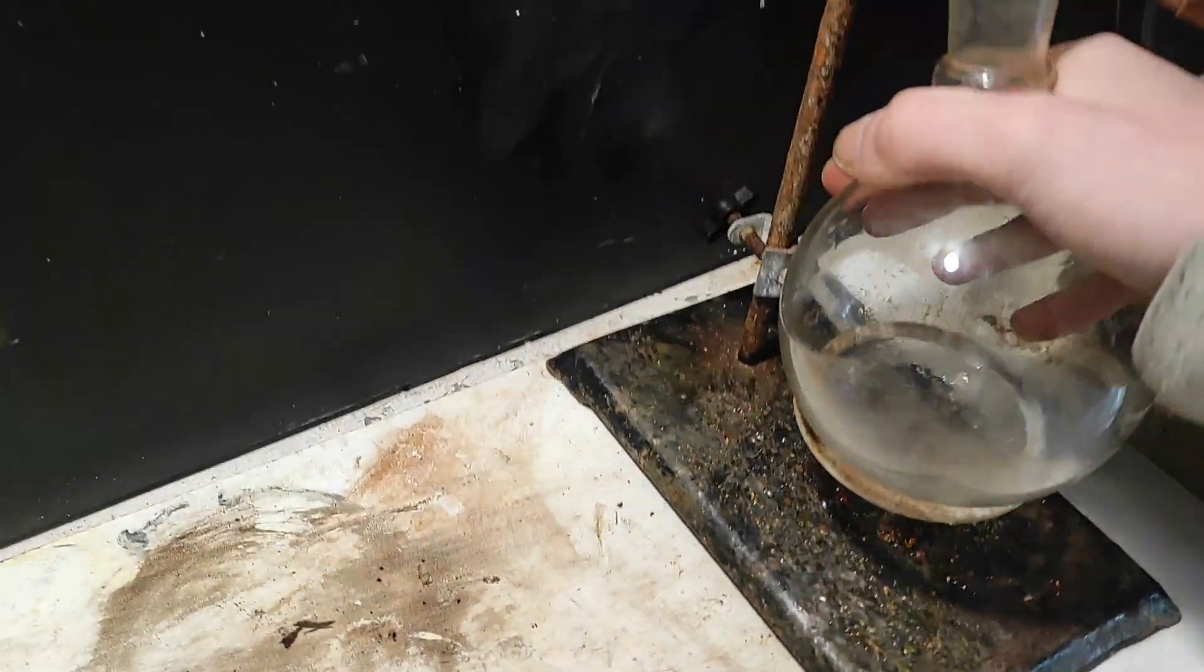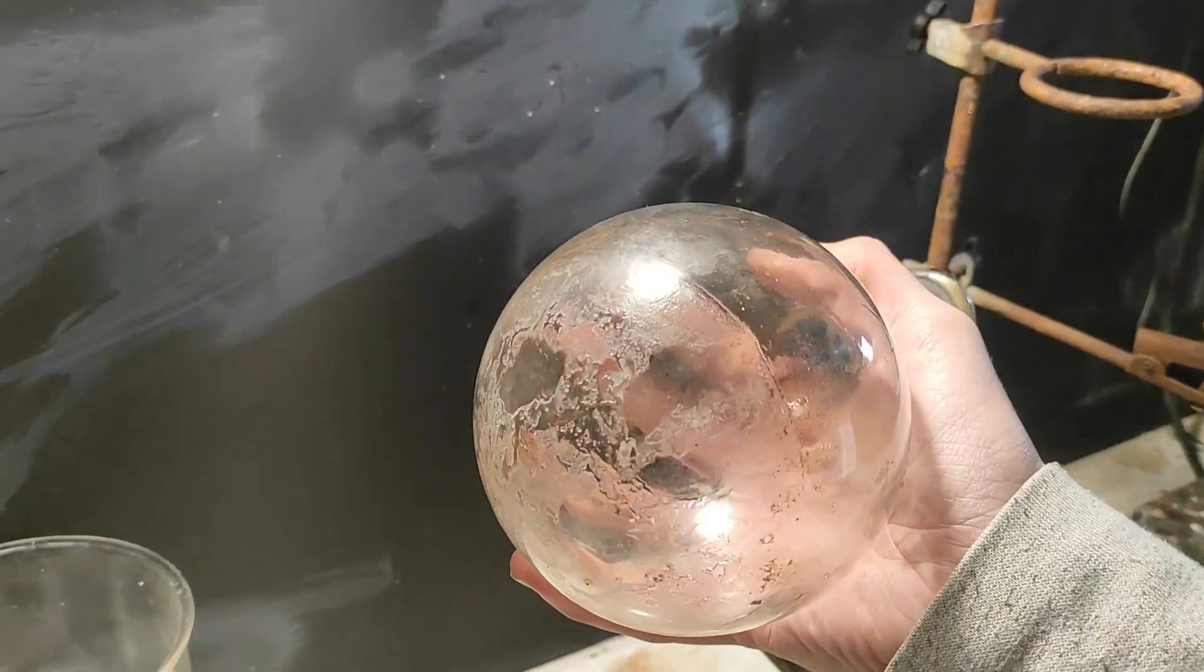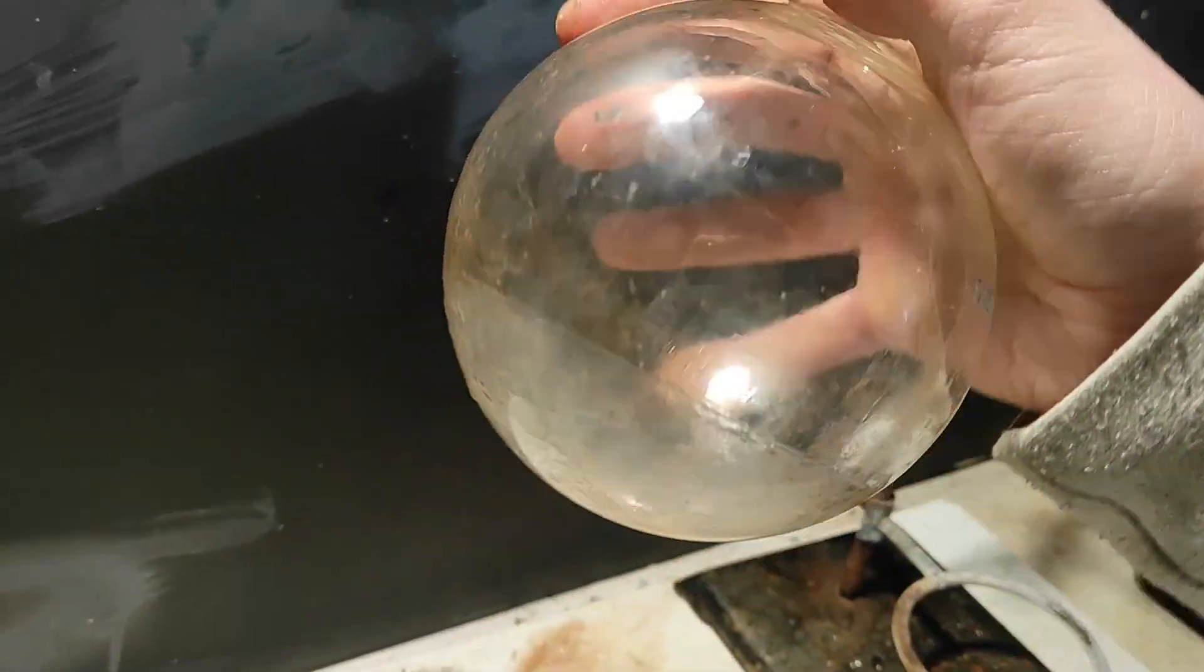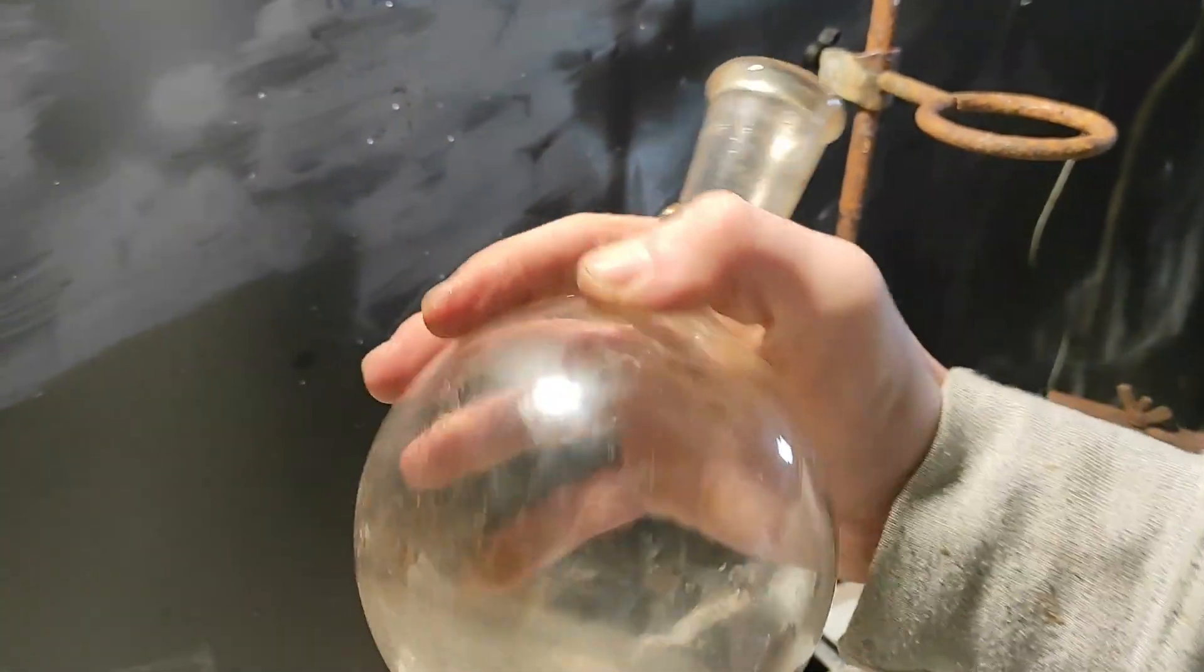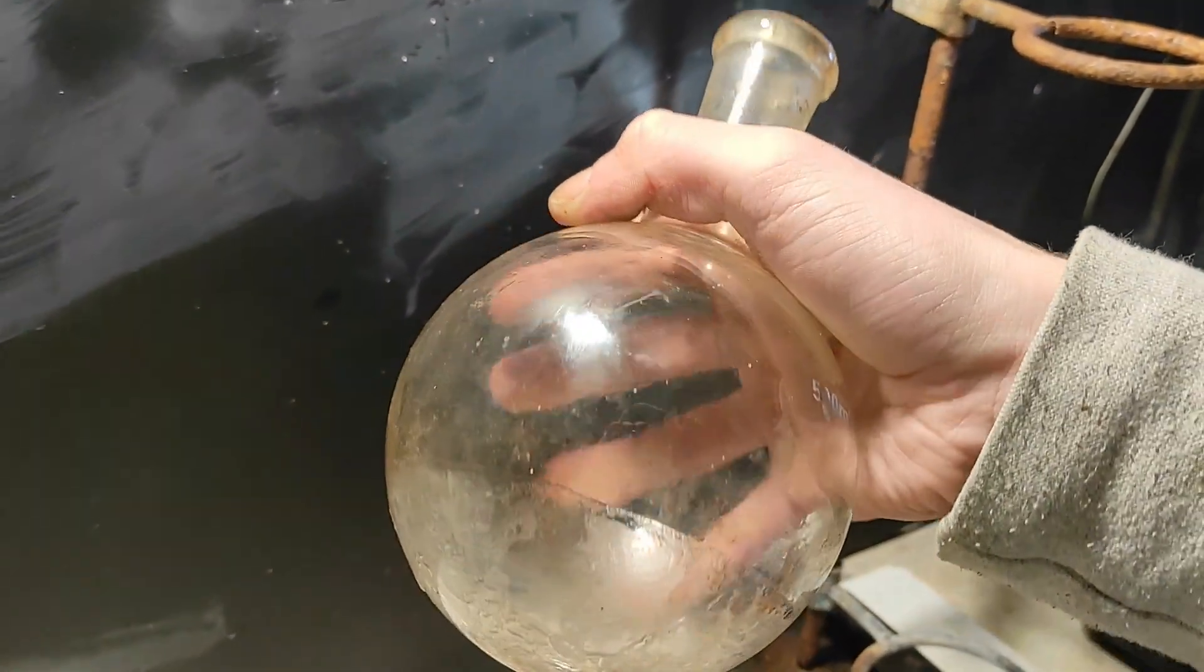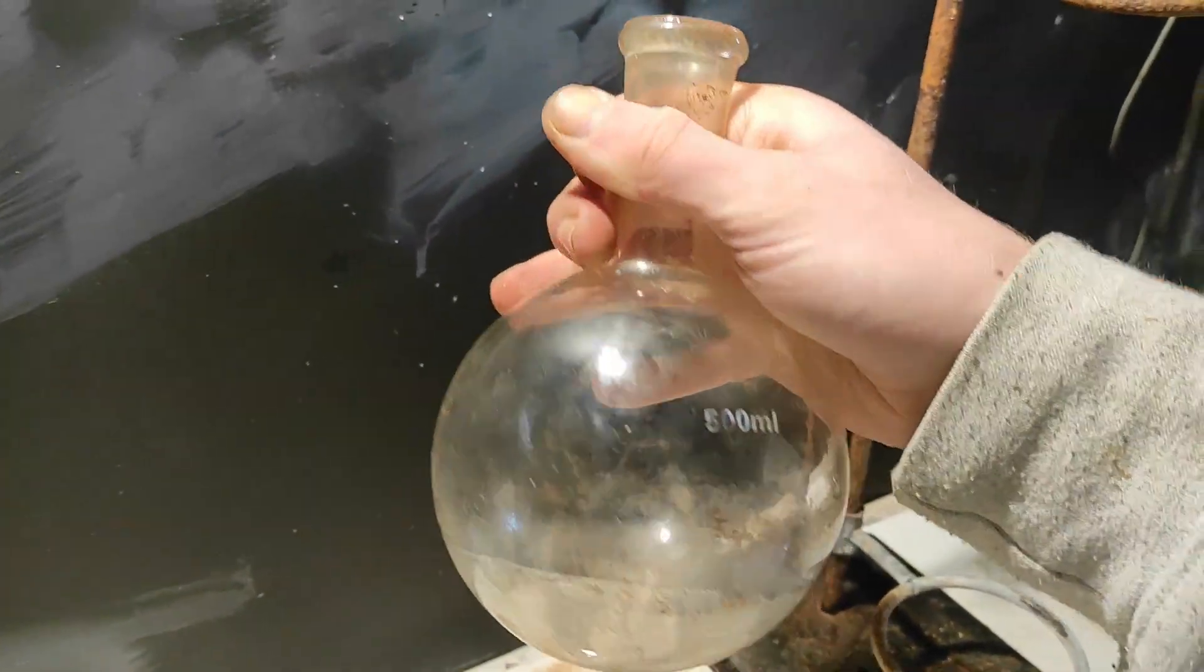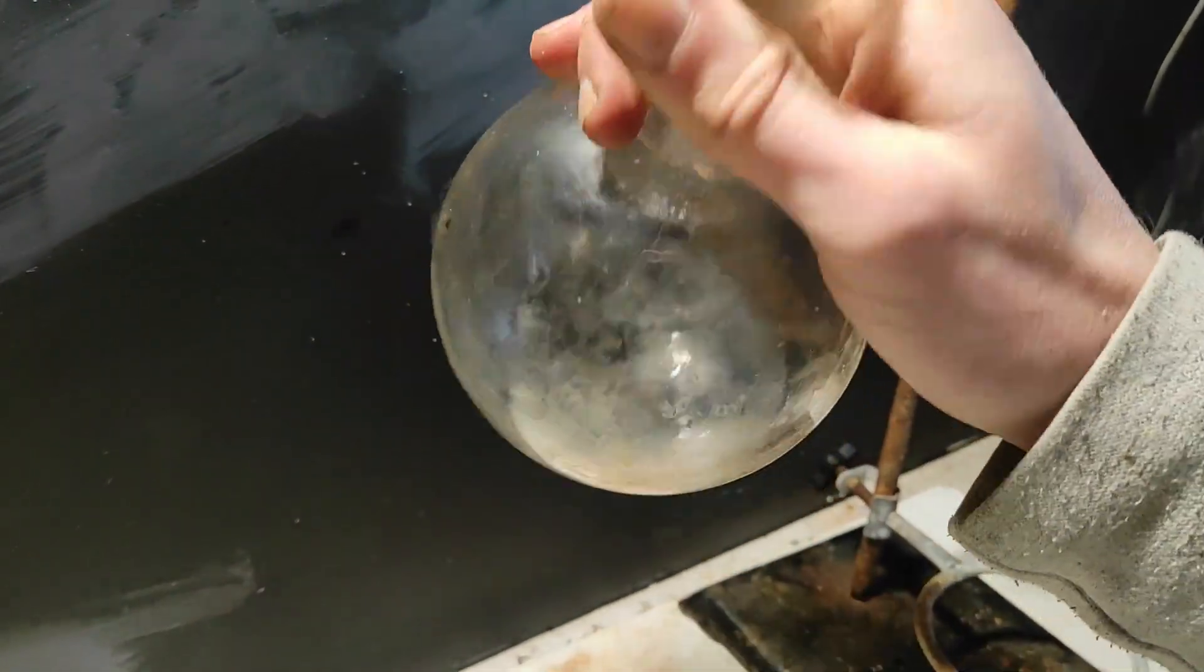Okay boys, so I just cleaned with a little bit of water, a rinse with some sodium hydroxide, and that's it. So now the flask is, I mean, it's not new at all. So, it's kind of bad looking, but it's as good as it was when I used it, I guess.